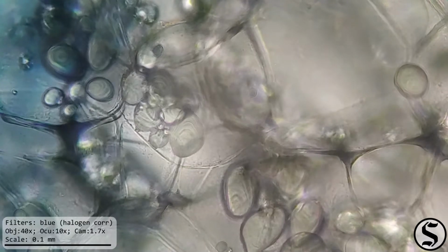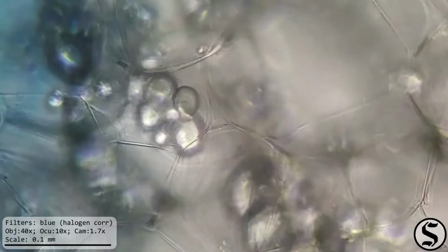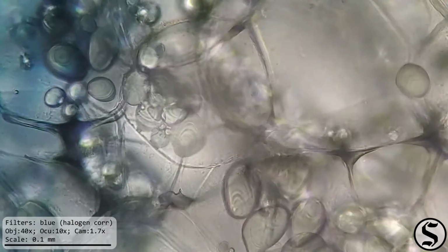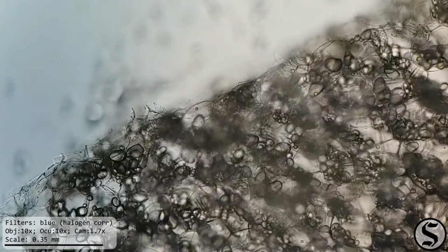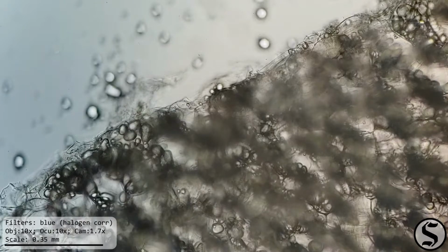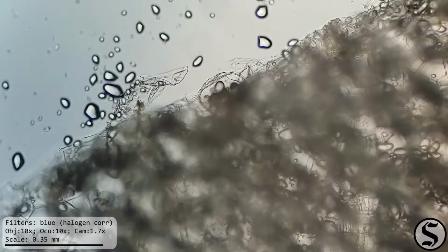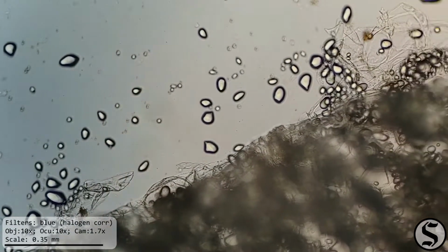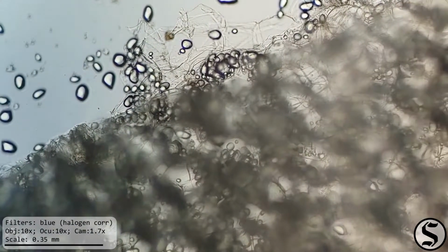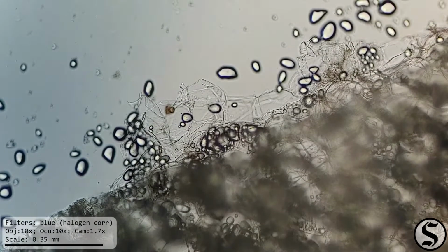I think it's neat seeing all of these starch crystals in here. Almost look like little gems. They produce interesting diffraction patterns. And then on the innermost edge of the potato, where I cut it in order to fit it into the microtome, we can see there's a lot of starch granules that have spilled out. And again, I think they look really neat.